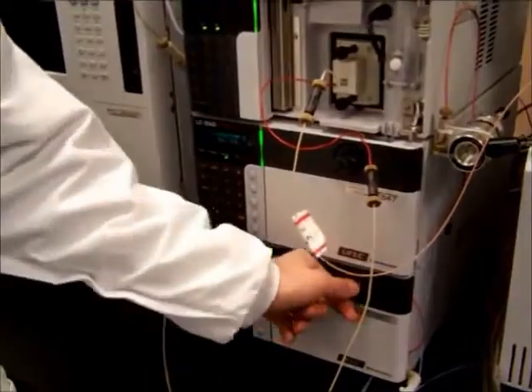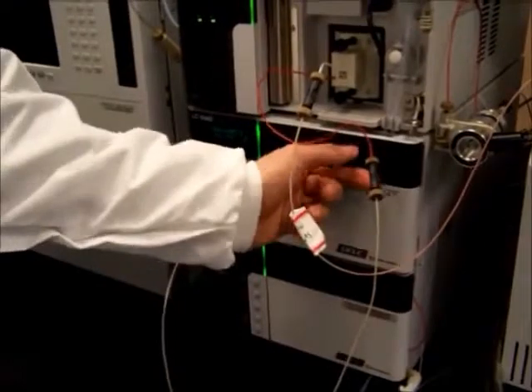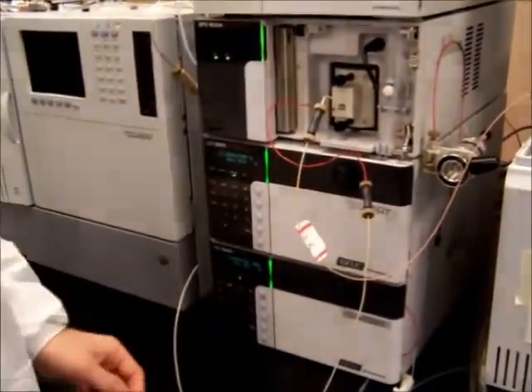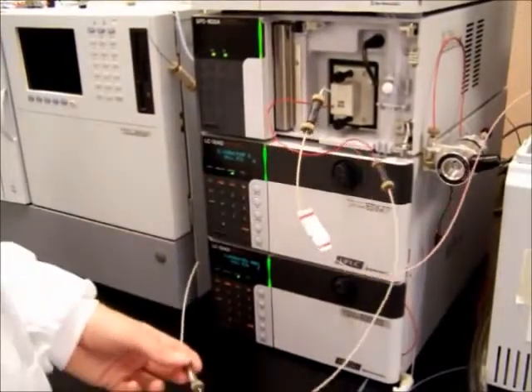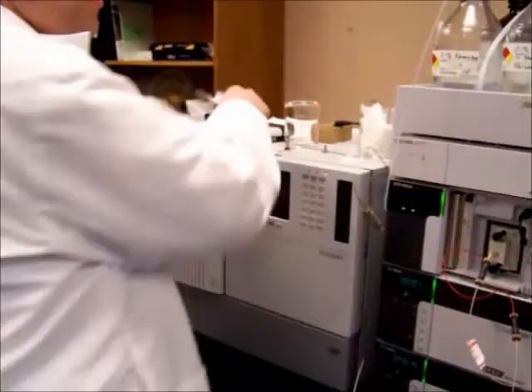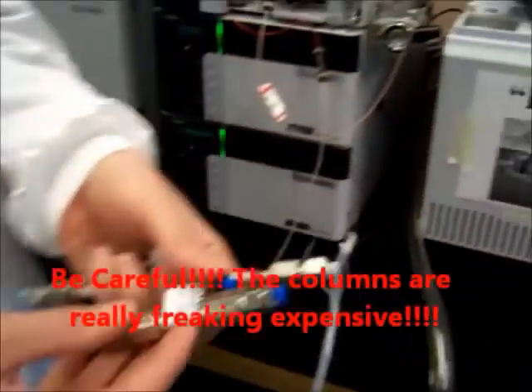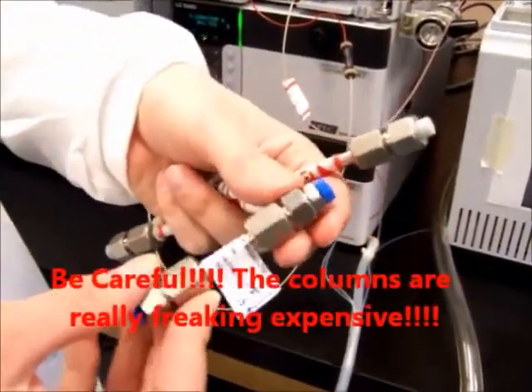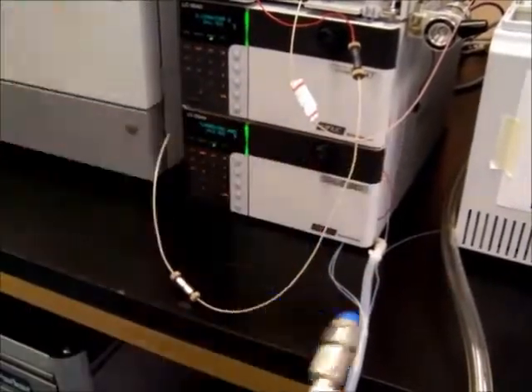First, close the valves by turning them 1/4 turn clockwise. At this point, we need to put on the columns. Now, in other videos, we've talked about the different columns that we have and the different columns we use. For today's run, we'll be using a 3 micron 50 by 2.1 millimeter column.